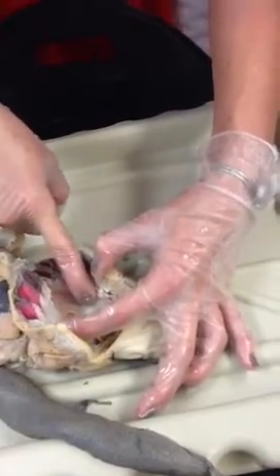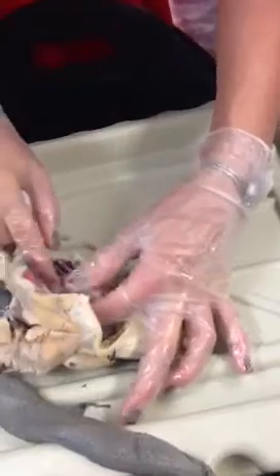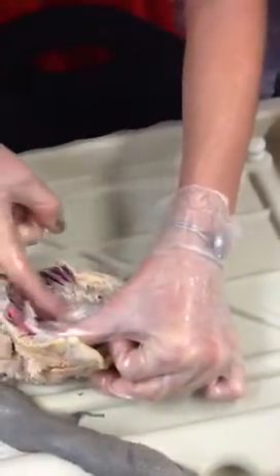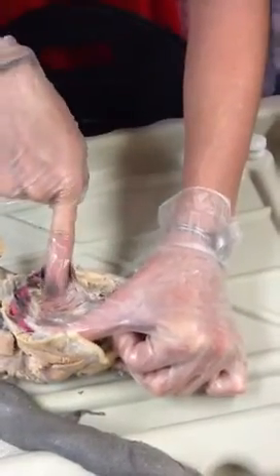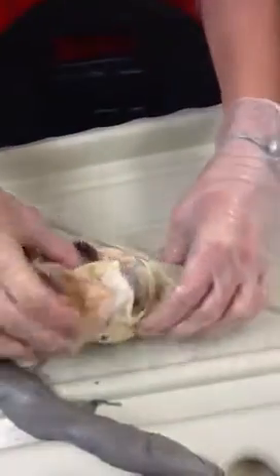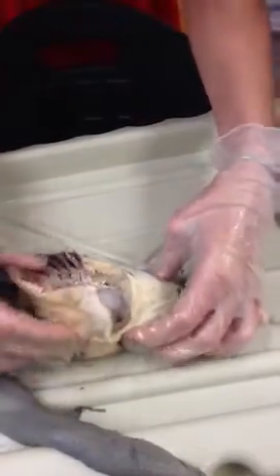Here we have our 1st through 4th efferent arteries, and they're all going to branch from the dorsal aorta out to the gills. On the 2nd efferent, we have this really squiggly artery, and that's going to be your esophageal artery.